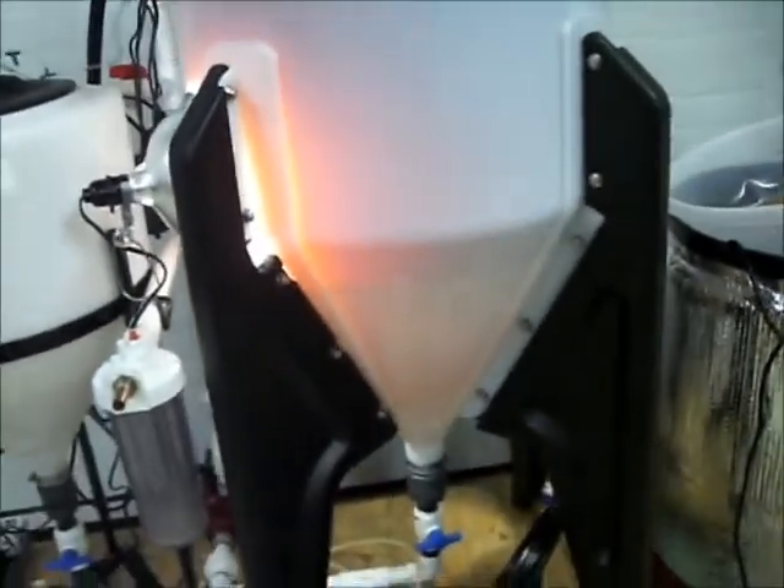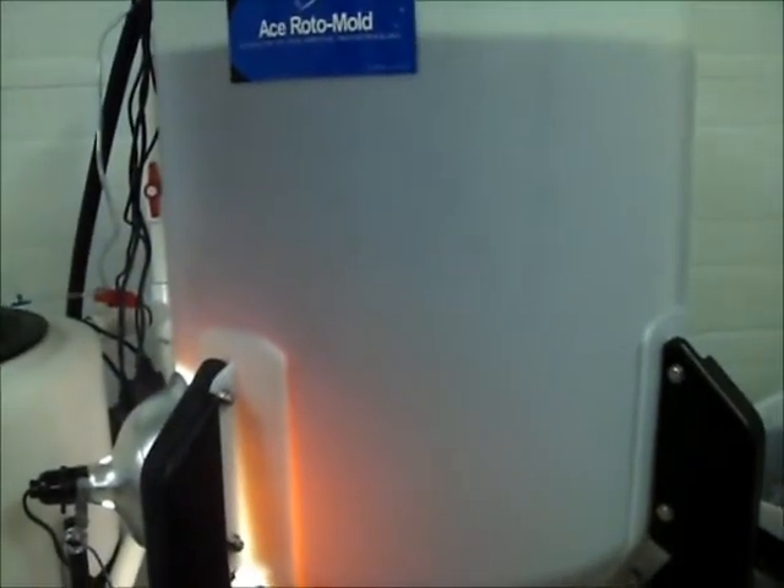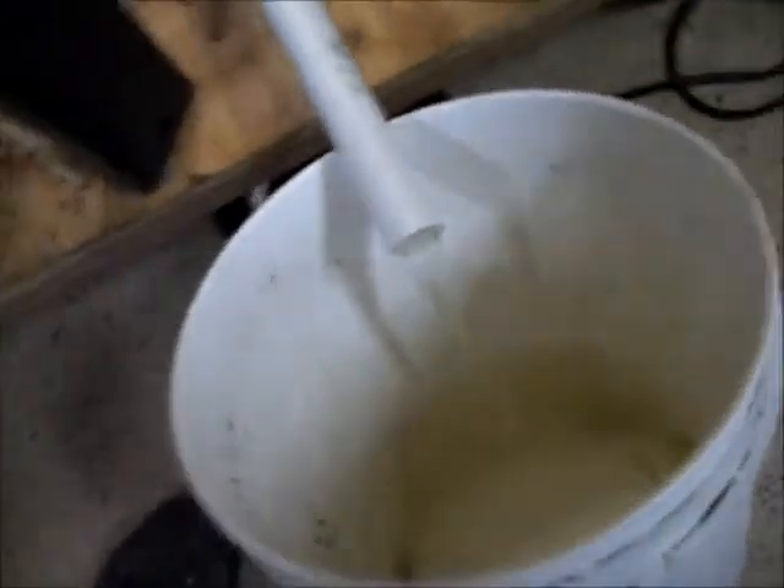This has been going for about half an hour, 45 minutes with the bubbler at the very bottom. See how clear that is at the bottom? That's a really excellent separation. And what we have on top — voila — semi-clear biodiesel. I may just leave it, start drying it with the heaters and the bubbler. Now this is the salt wash water coming out and it is quite clean. Let's check the pH — 9.3. That's definitely not 11-point-something anymore, so that's a good sign.